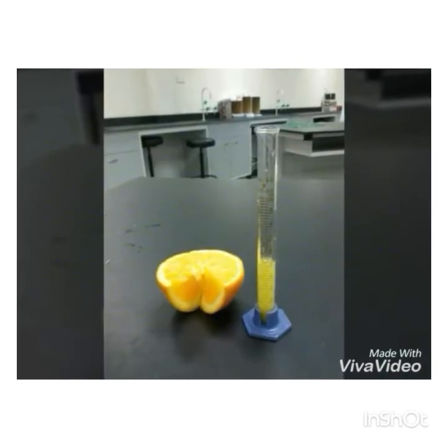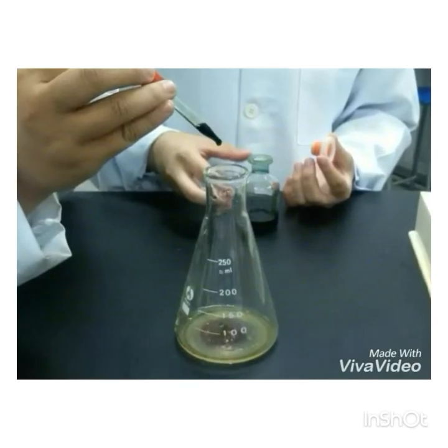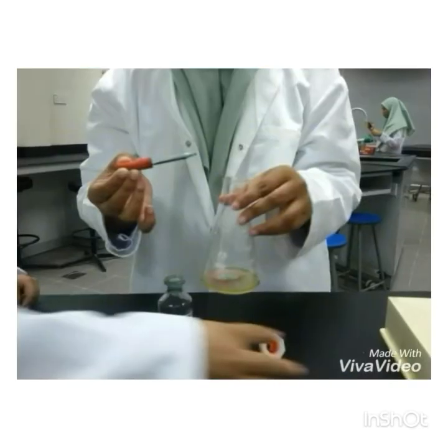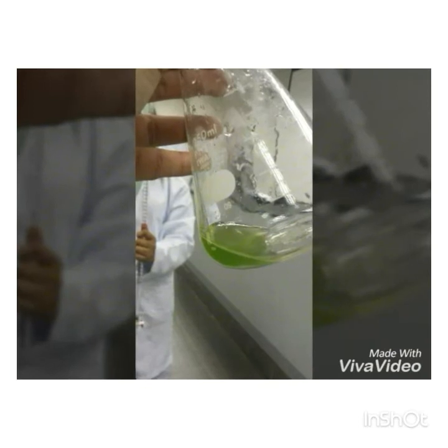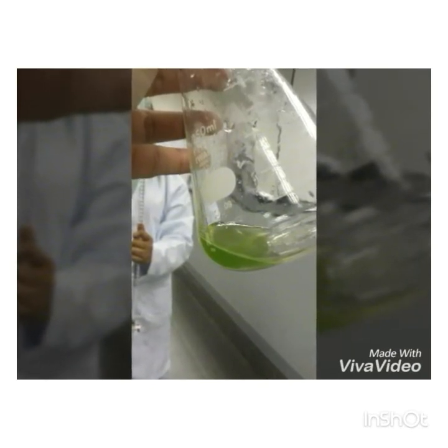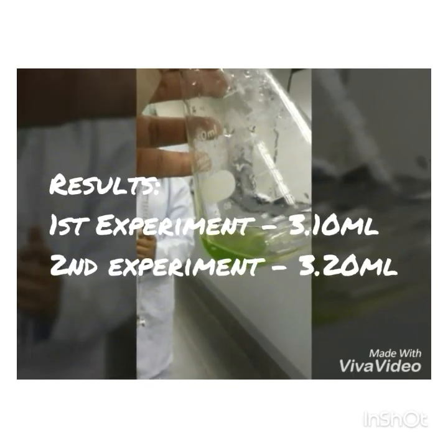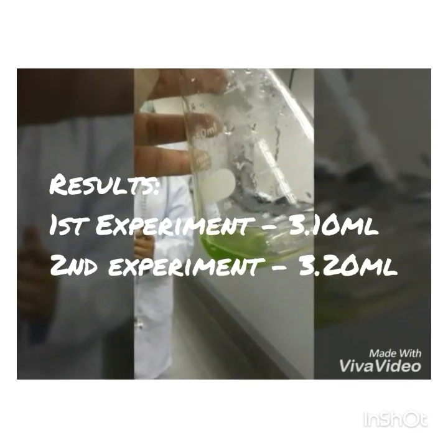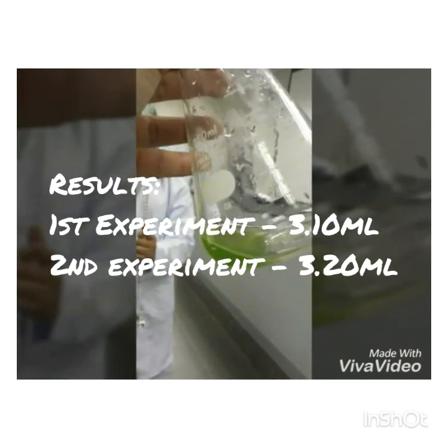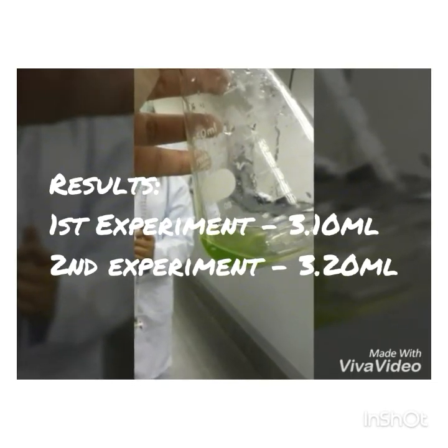After that, we did the titration for orange. We used the same amount of orange juice as the lemon. Then we added 4 drops of indicator into the conical flask with the orange juice. Next, we followed the same process as for the lemon until the orange turned into a yellowish green color. The reading for the first time of the volume of the sodium hydroxide we used is 3.10 milliliters. And the reading for the second time was 3.20 milliliters.